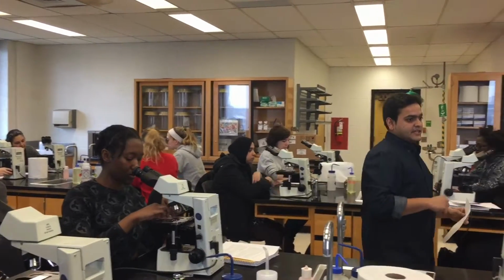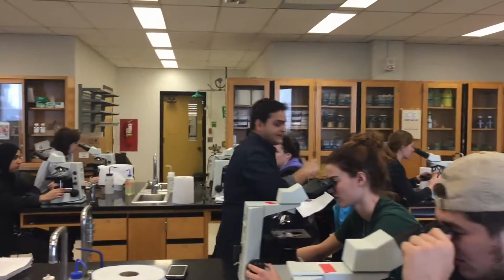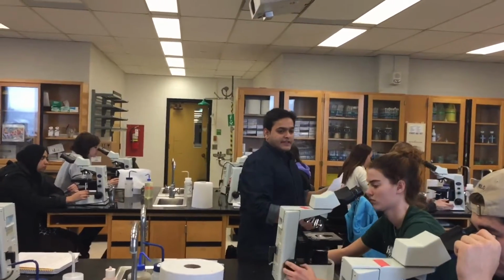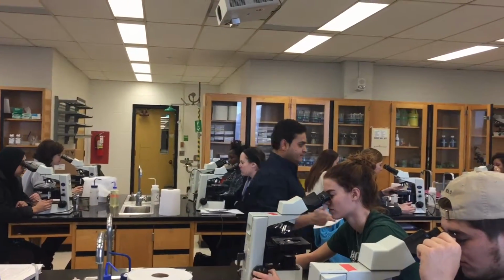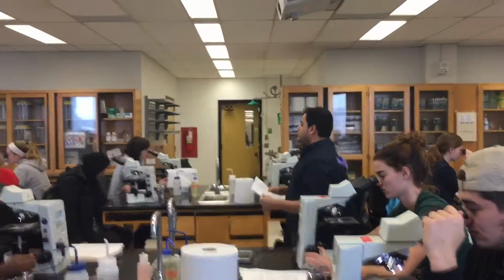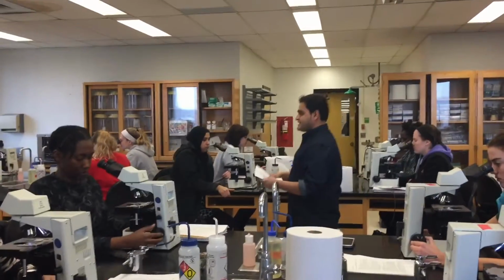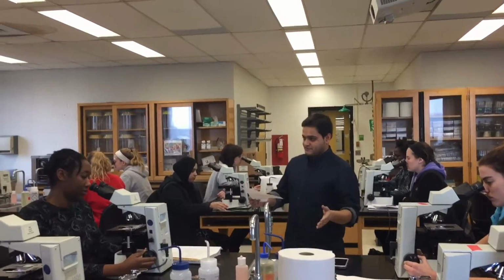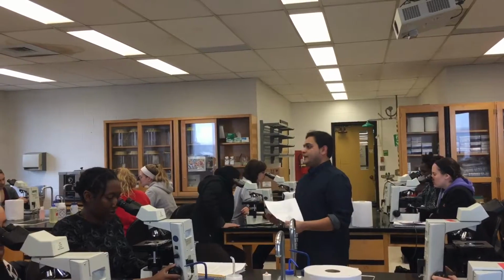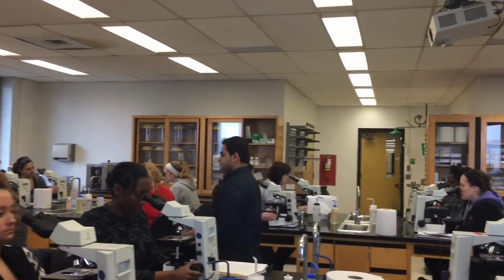Keep your eyes there. Let it go down. While you're going down, you might miss it in the middle, so then you have to come back slowly again. If you're using the microscope for the first time, it might need some patience. Just try to find it. Once you get used to it, it will be a piece of cake for you.